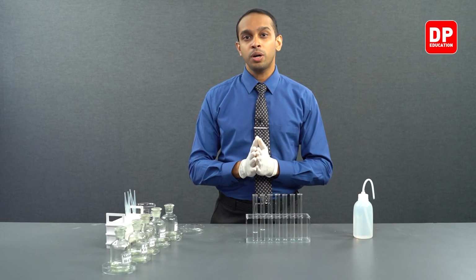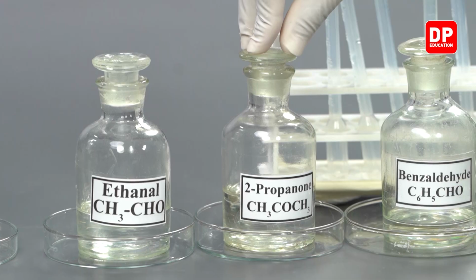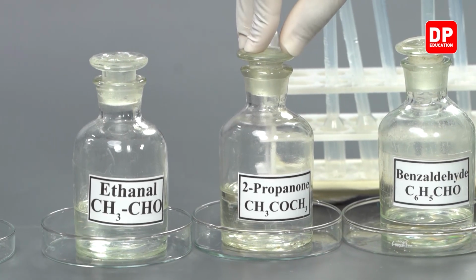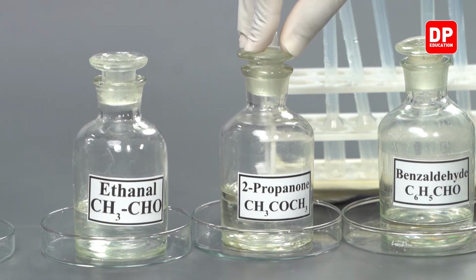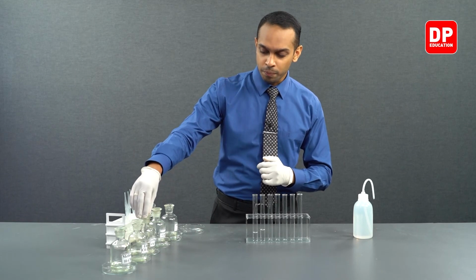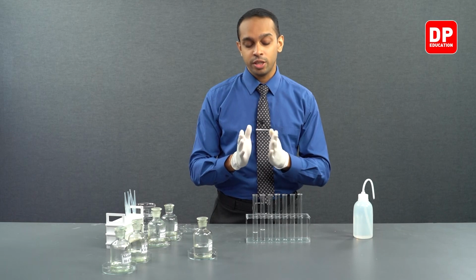Let's move on to a ketone. So we have here 2-propanone. Now 2-propanone is commonly referred to as acetone. I'm pretty sure that most of you are very familiar with acetone. So we will take our 2-propanone and see if it is soluble in water.